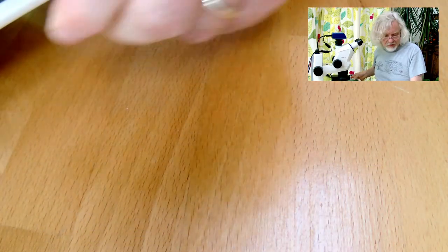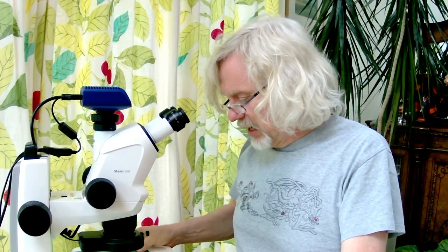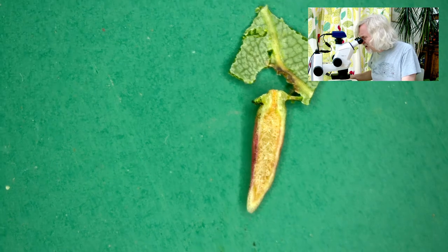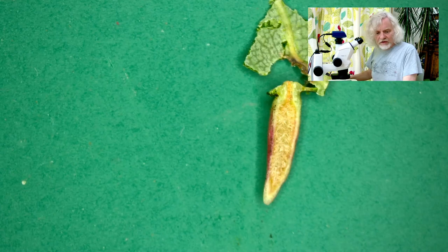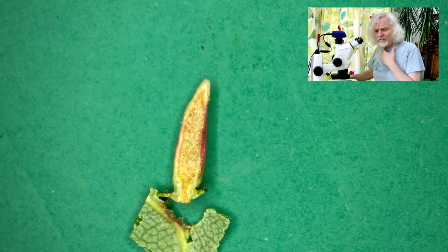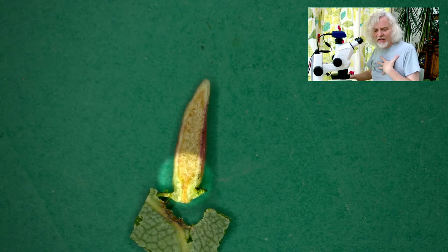So I'm going to stick this under the microscope. While I'm doing that you can come back to this. I'm going to line it up and make sure I've got the right thing. Let's just have a little zoom in. I'm going to focus on this thing. That's actually pretty good. Right, let's go to the microscope. So there you go, that's what it looks like. Actually I've got it back to front and upside down — there, that's better. So there it is, it's a peculiar looking thing. This is the base where it was attached to the leaf, and then that's the length of it — about seven, eight millimetres long. And you can see it's sort of full of fibrous stuff.